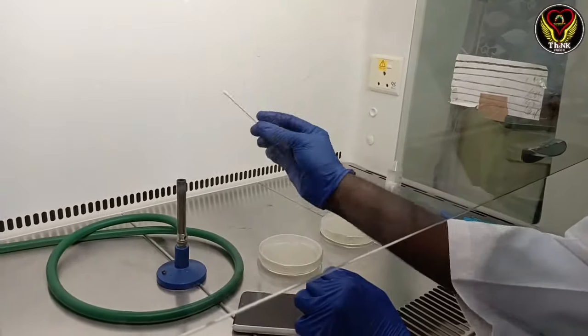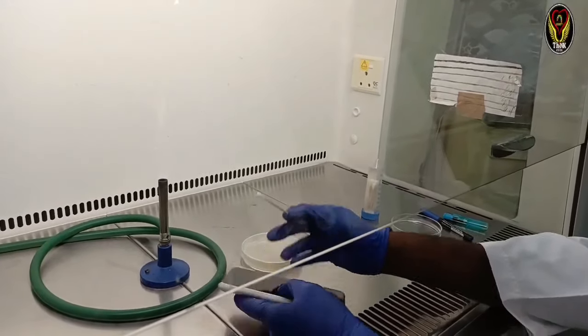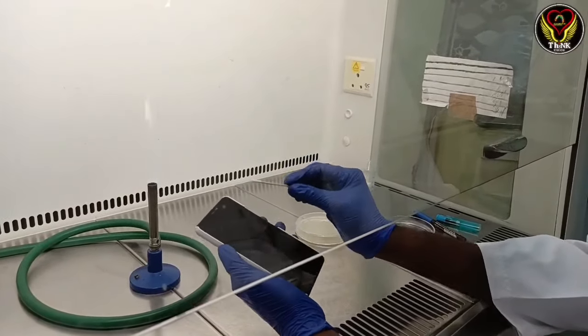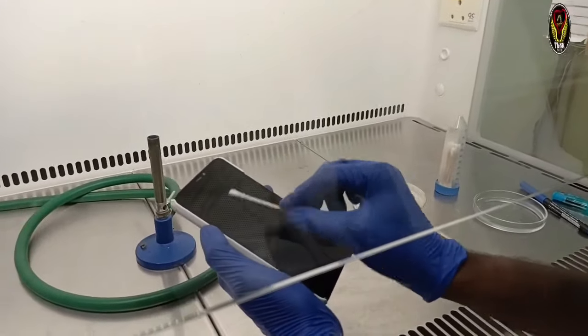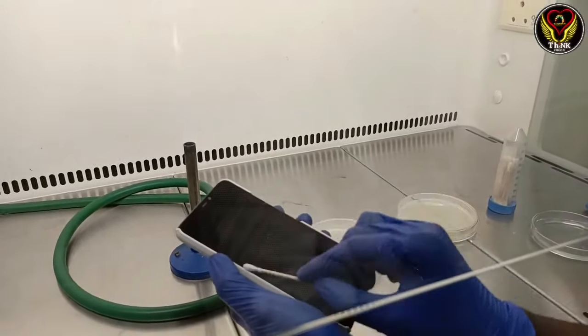It will dip in the distilled water and pass through the flame to sterilize it. Now I will take the swab to the sample. I will touch the swab on the surface and touch the region.